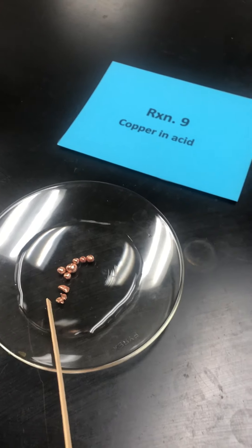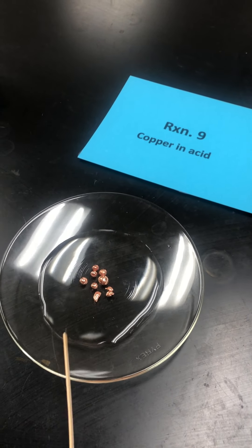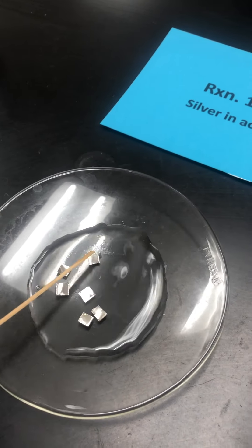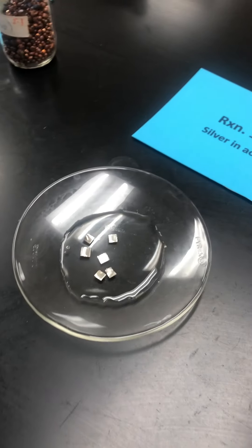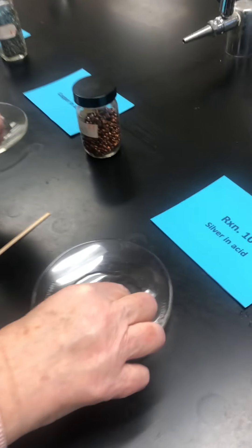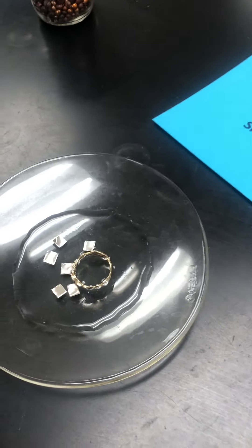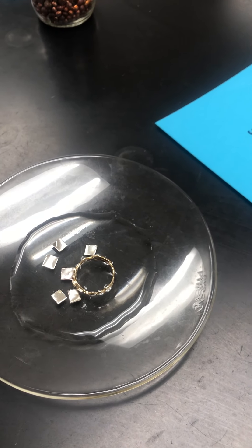Here I have the beautiful copper still sitting in the hydrochloric acid and the beautiful silver sitting in the hydrochloric acid. In fact, I could take my beautiful gold wedding ring, don't you worry videographer, and put my gold wedding ring right there next to the silver in the hydrochloric acid.